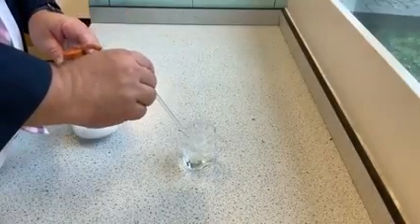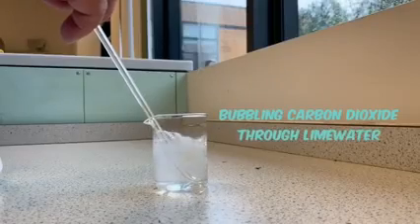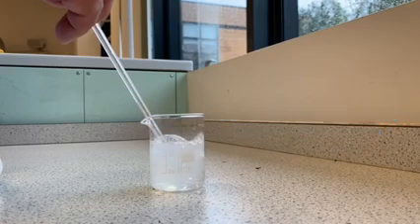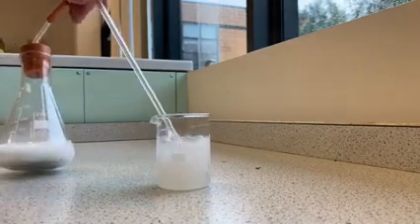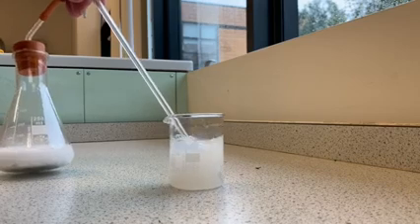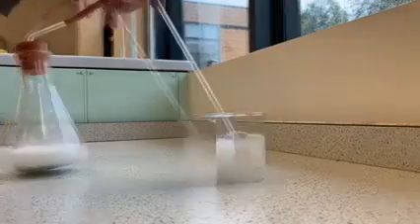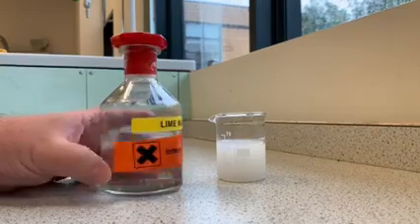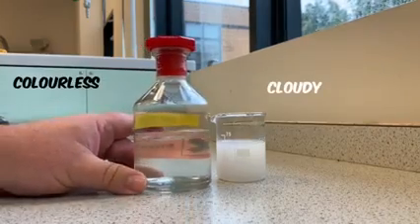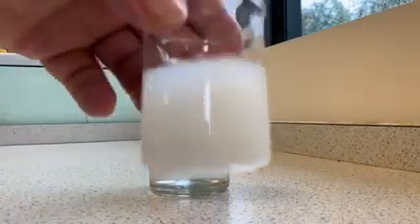I've got my little delivery tube here, and I bubble the carbon dioxide gas through the colourless lime water, and if we look carefully we should see that the lime water goes from being colourless to being milky, or cloudy we could say. It's a precipitate that forms inside which makes it go cloudy or milky. So just to compare, here we have lime water, which is colourless. If we bubble carbon dioxide through, it forms a cloudy precipitate.